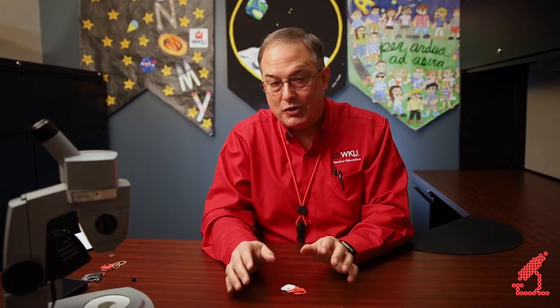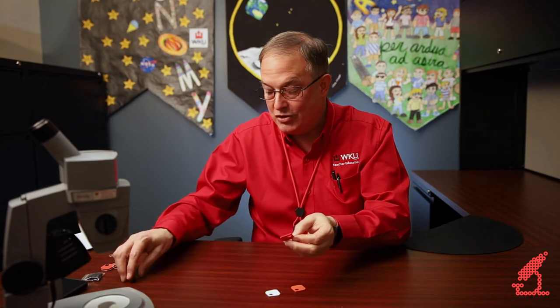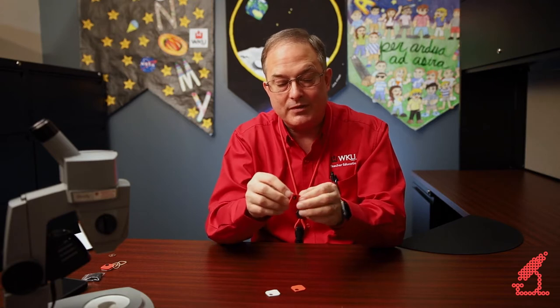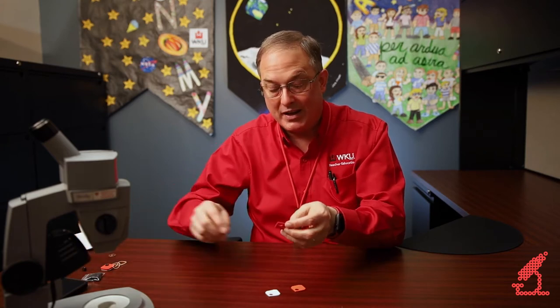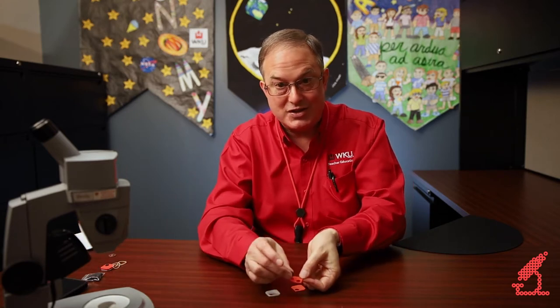What I actually like to do is cut these with a Cricut. If you're familiar with the Cricut, you would know this would be a very easy thing to do — you could make hundreds of these little templates. In our supplementary materials we have a link to a file where you can cut this. But all this really is is a small square with a hole. That hole needs to be just a little bit smaller than the lens you're using so that the lens kind of sticks in there by friction. If you're using our Cricut template, it's simply programmed to cut a hole that matches this particular lens.